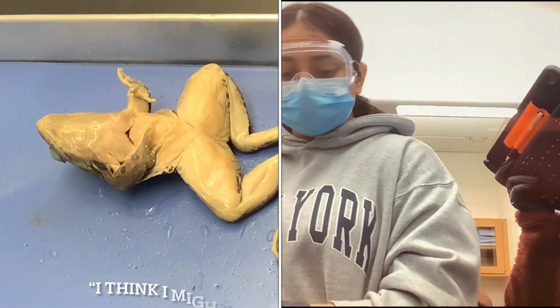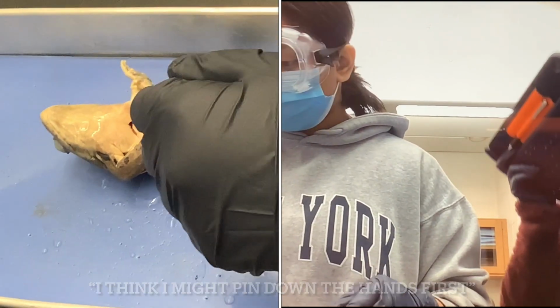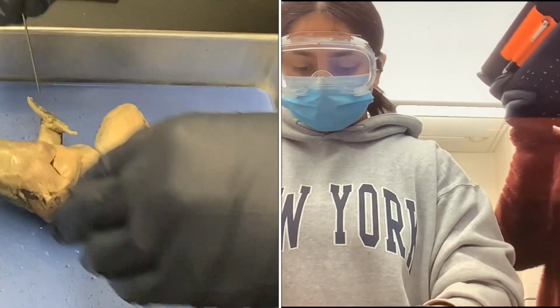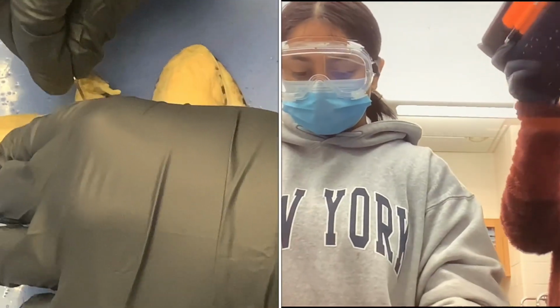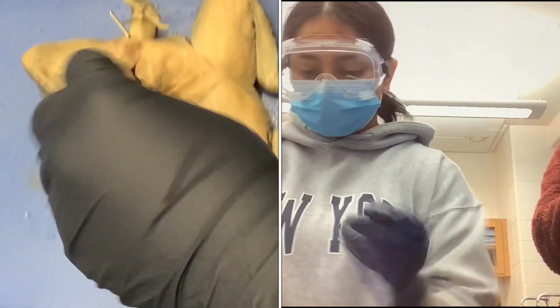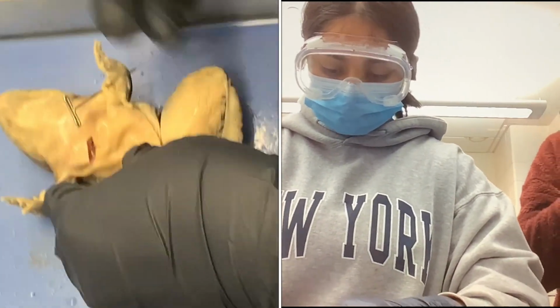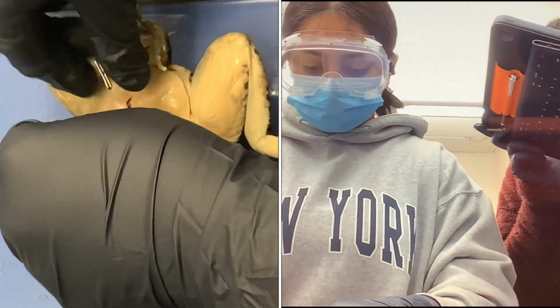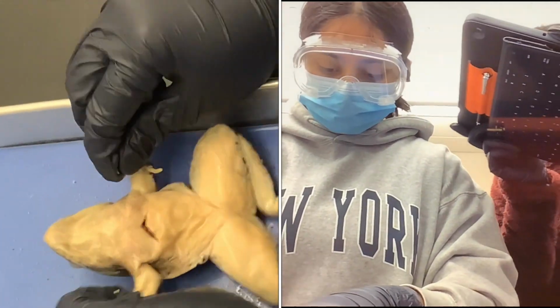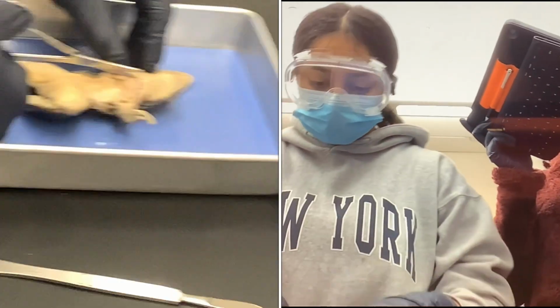I think I might pin down the hands first. So now I'm actually going to make the vertical incision.